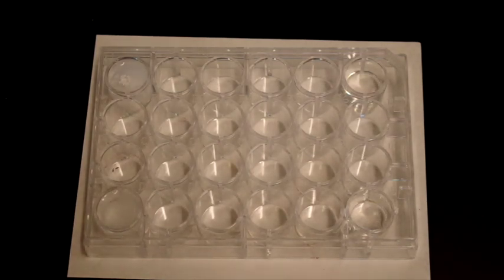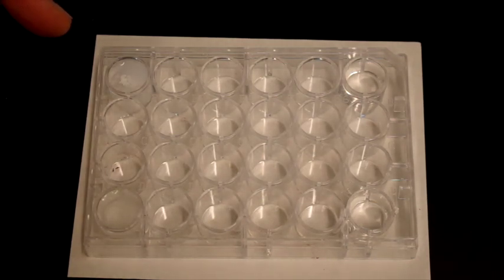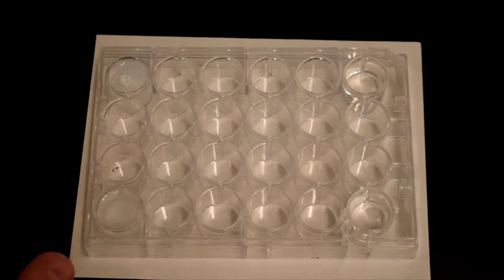So there are 4 results shown here. Top left corner is sodium chloride plus silver nitrate. Bottom left corner is silver nitrate plus sodium sulfate. Top right corner is calcium nitrate plus sodium chloride. And bottom right corner is calcium nitrate plus sodium sulfate.